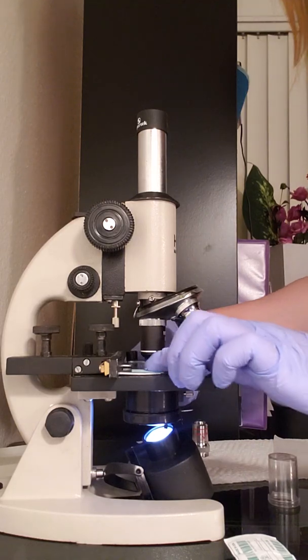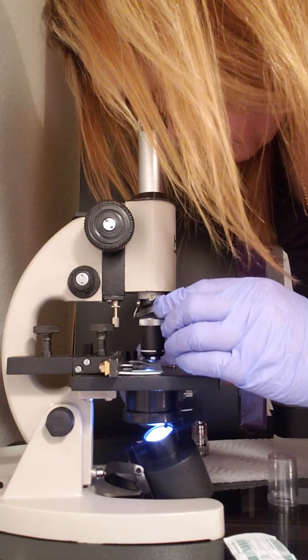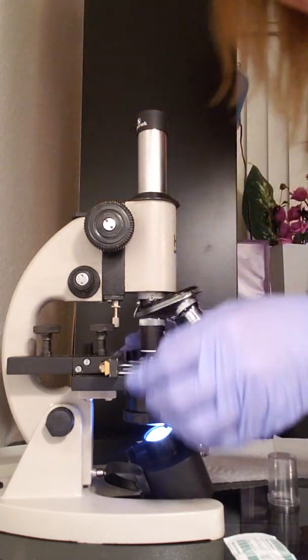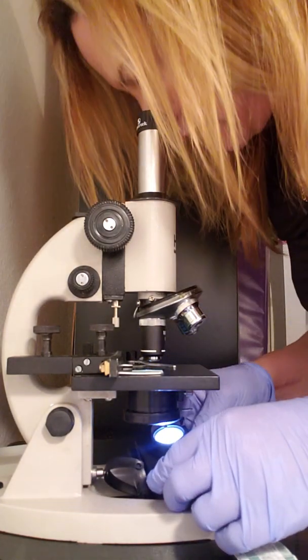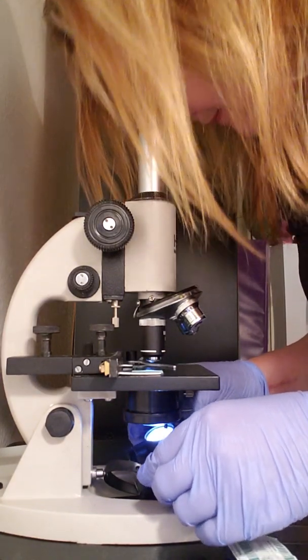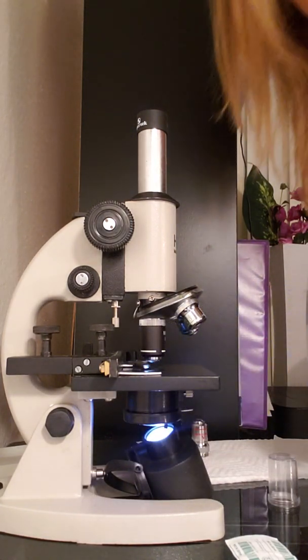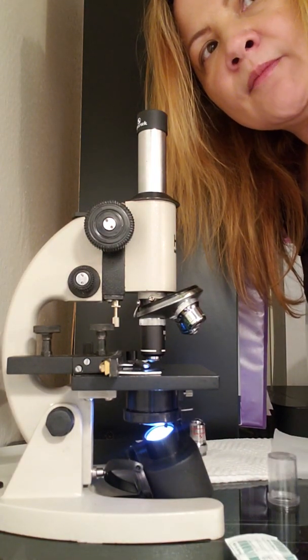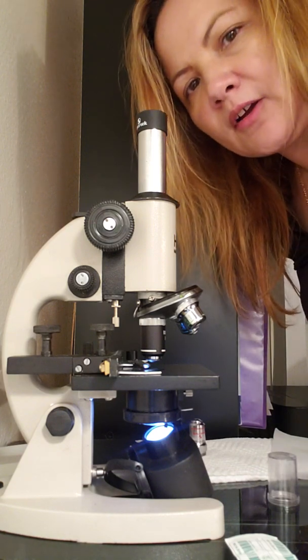And I'm actually using the 100 power. Oh wow, see? You get a good view. So this does really a good job. And sometimes the lighting needs to be adjusted to make it better. Okay. And there you have it. And that's for this exercise. And following that, I will go on to the next part.